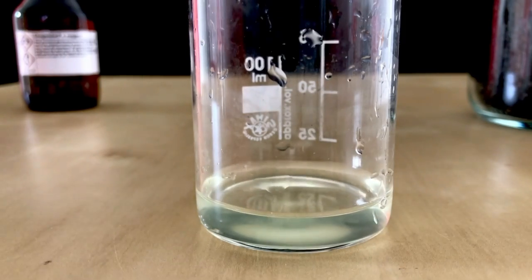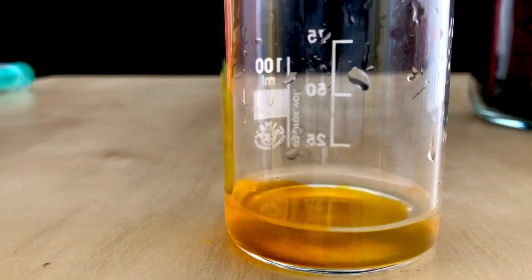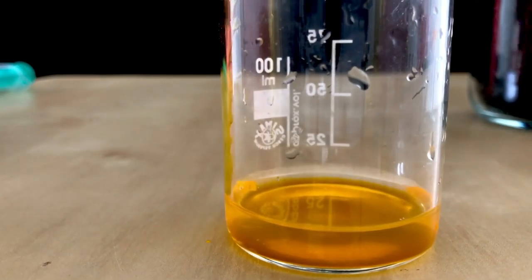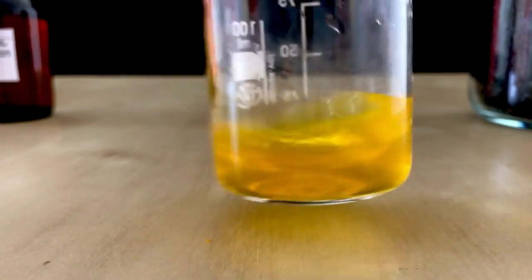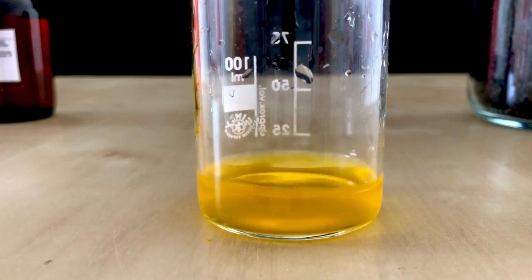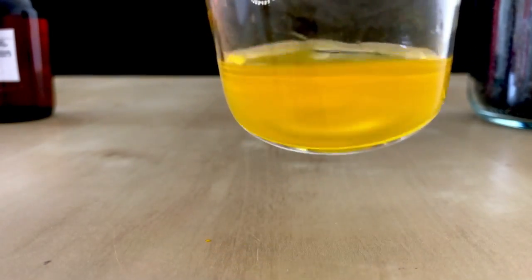I added the solution to some more distilled water. However this isn't necessary and the reagent could be dumped in directly. After adding the reagent the beaker was swirled around, left to stand for 10 minutes, and then we observed it again.